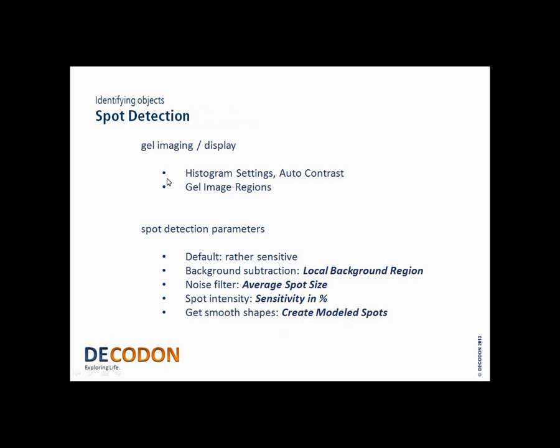And then we want to identify objects on the fused image. This is done by spot detection, and of course, to do this, we have some helpful views and changes in the settings of the views. For example, you can adjust the histogram settings. With one of the last versions of Delta 2D, we have introduced that the contrast is set automatically during the import of images, and we also offer a gel image regions view where you can see the same region across all the images. Of course, the histogram settings do not affect the quantities. Quantitation is done on the original images, of course, after background has been subtracted. But the contrast settings do not affect quantitation of spots. It just affects the display of the images.